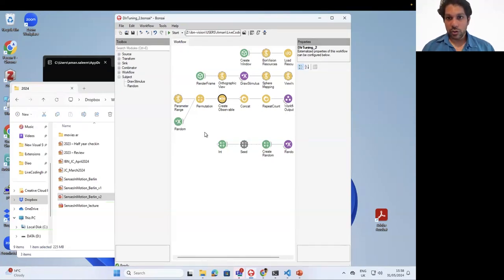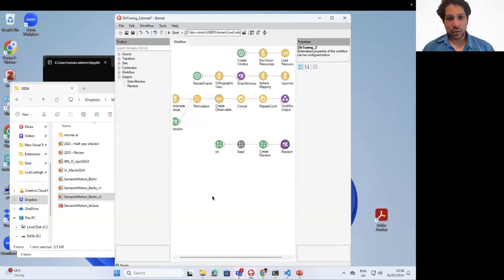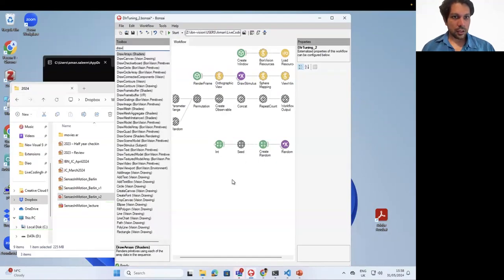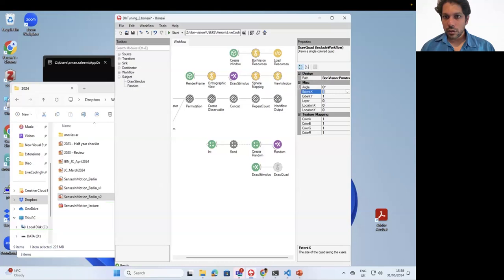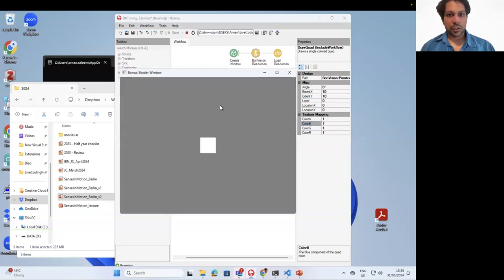So in BonVision, the way we could do it is, again, really simple. I would use a node called DrawQuad. I'm just going to temporarily inactivate these nodes and just show a DrawQuad node. So now, let's say draw stimulus, and then I have a DrawQuad. In this case, we have a view window. Let's make it a little bit bigger, so 10 degrees and 10 degrees. And it's white because it's 1, 1, 1. Let me just play this. So there's a white square.